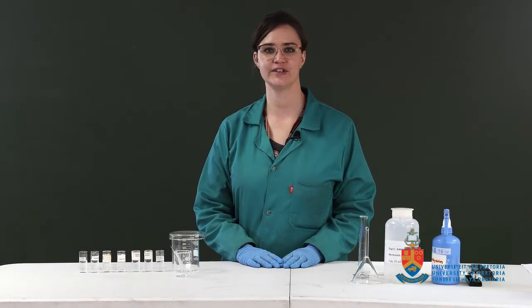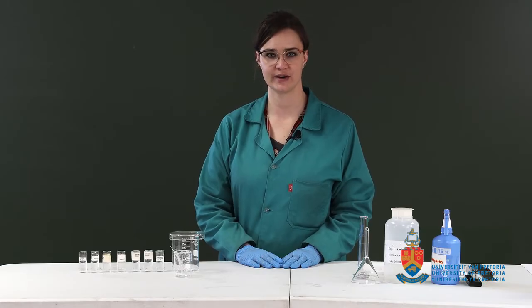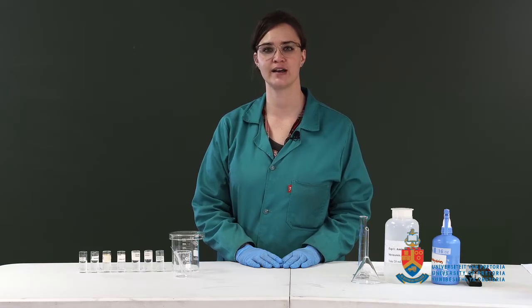Hi guys, welcome to your first virtual practical. Practical 1 is going to be a chromatographic practical. So we're going to go through experiment 1 first, which is to determine a mixture of unknown amino acids.